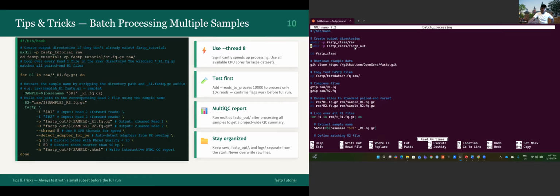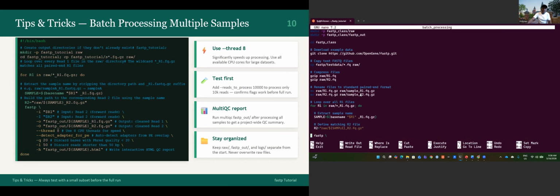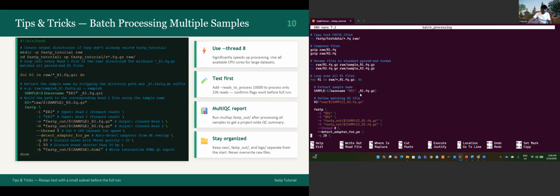This is just to store the output data, because it is not recommended to overwrite the raw data. You need to store the raw data in a specific directory and the output in a specific directory. So this script will do the same: it will navigate and download the data and do exactly what I did in the command line. This is what this script will do also.